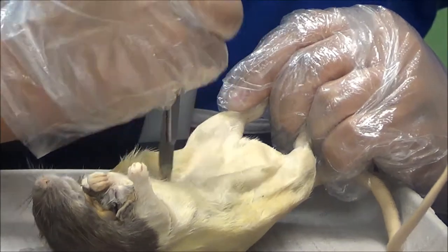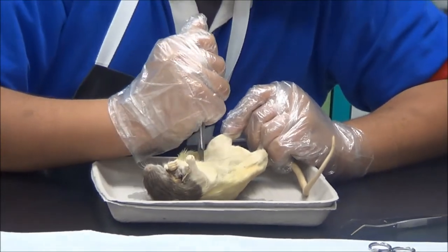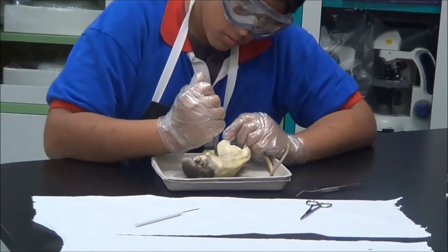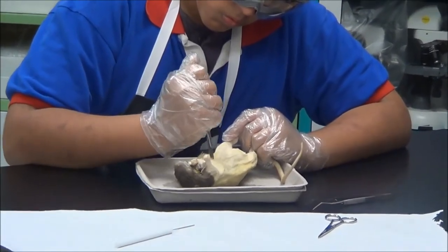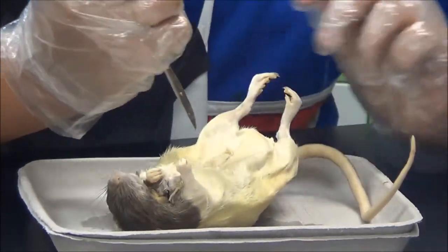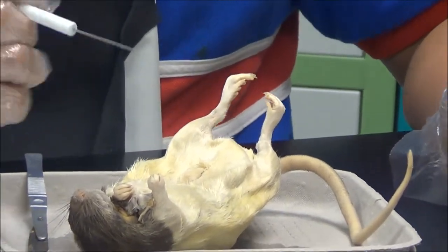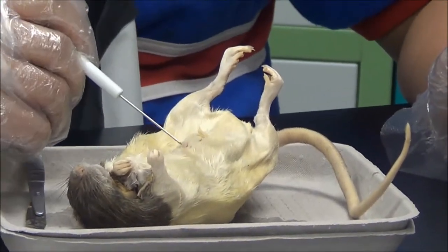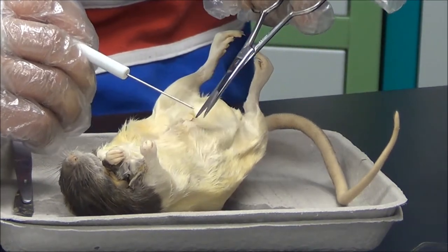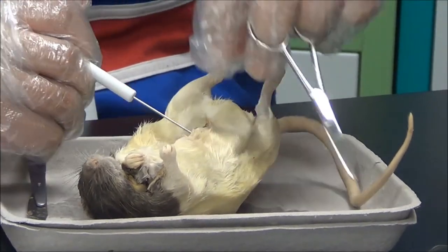You will be cutting from the bottom up, or top down. Once the skin is cut from the neck to the bottom, you will want to grab your scissors and your poker, insert the poker into one of the skin layers, and take off all the fat. Hold the skin layer with the scissors and with the poker gently take off the fat.